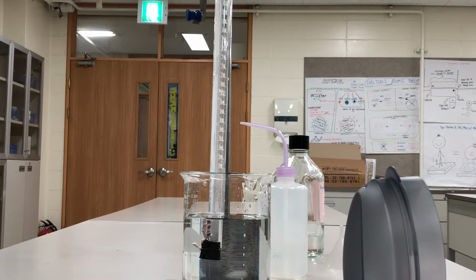Then we need to take the temperature of the reaction, which is the temperature of the water, which is room temperature. I think earlier today it was 21.6 degrees Celsius. You're going to want to convert that into Kelvin. So you will have nT, which is in your denominator. You'll have the pressure, which we already stated in the video, and then you'll have your volume, which will be measured in milliliters, but you'll need to convert that into liters. So your units for R are going to be L·atm/(K·mol).